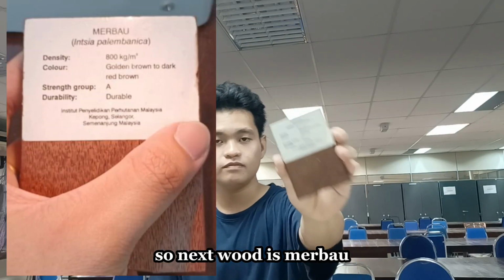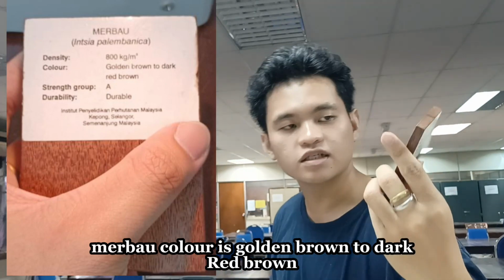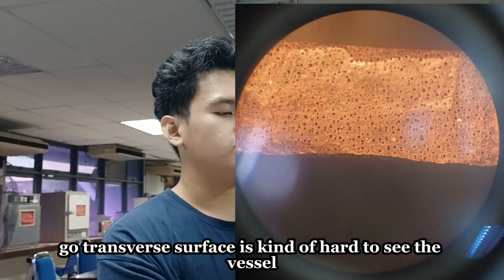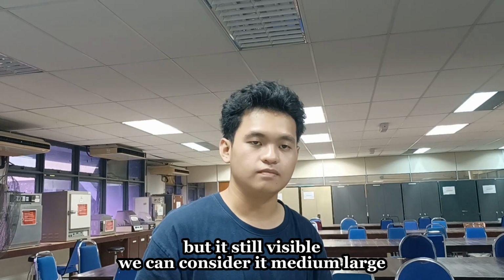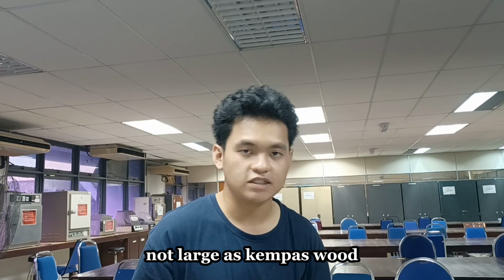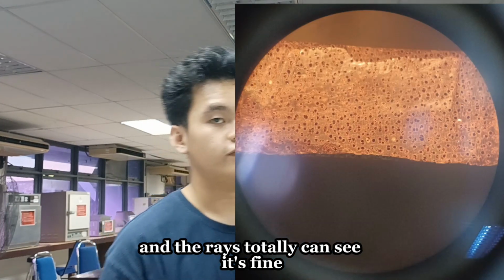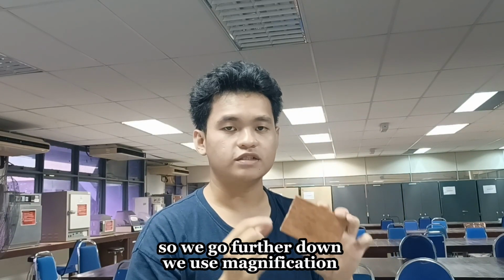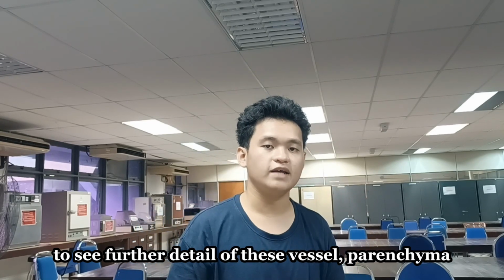So, our next wood is merbau. Merbau's color is golden brown to dark red brown. And we go to the transverse surface. It's kind of hard to see the vessels, but they are still visible. So we can consider them large, but not as large as kempas wood. And the rays, we totally cannot see the rays. Therefore, the rays are very fine. And so we go further down. We use magnification to see further details of the vessels and parenchyma. Let's begin.